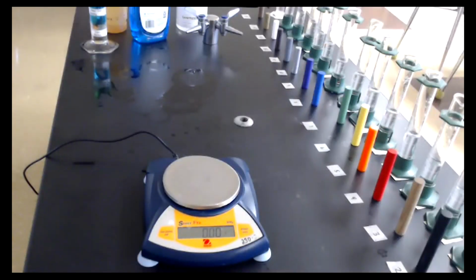So just showing you a picture of what the samples look like right now. They are unidentified, and you can see there's a bunch of different colors. They're all cylinders. They have different heights. Some of them are metals. A lot of them are plastics. So what we're going to do is we're going to take a look at each of these, and we're going to put them on the balance at first, and then we're going to try and measure the volume by water displacement, which we'll talk about as well. And we hopefully will get all of the data that we need.